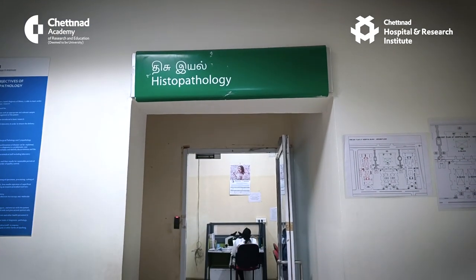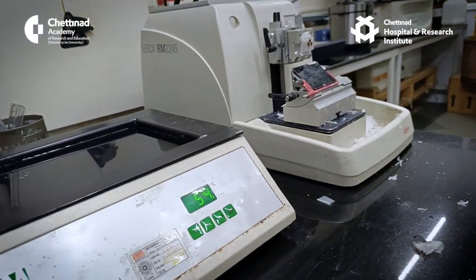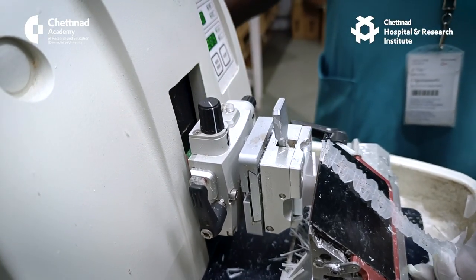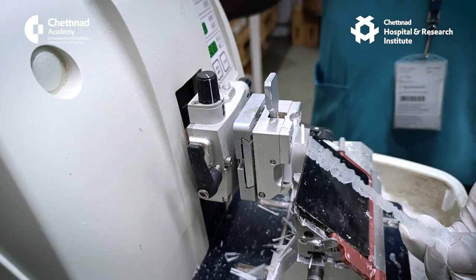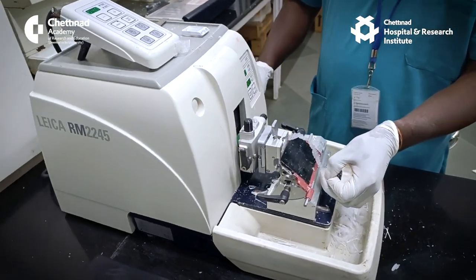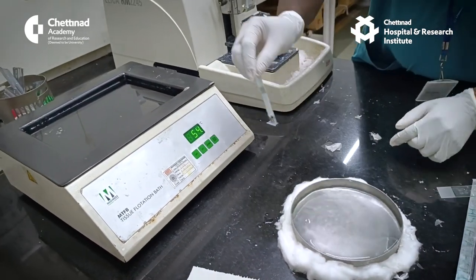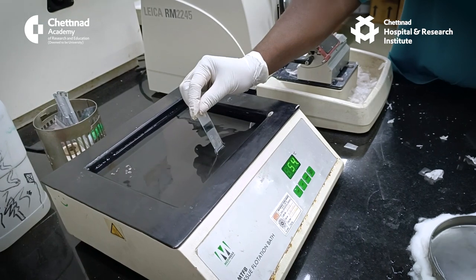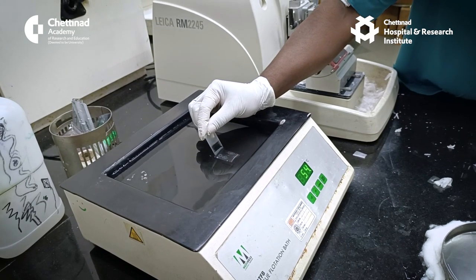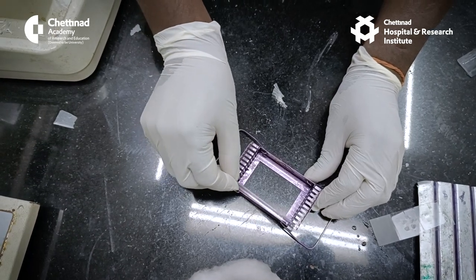The surgical pathology laboratory provides accessioning, description, dissection, grossing, and submission of fresh and fixed tissue material from biopsies and partial or total organ resections to the histopathology lab for routine processing, as well as specialized procedures such as special stains, immunohistochemistry, immunofluorescence, rapid tissue processors, automated paraffin embedding stations, automated microtomes for tissue sectioning, cryostat rapid tissue sections, and fluorescence, polarizing, or phase contrast microscopy.